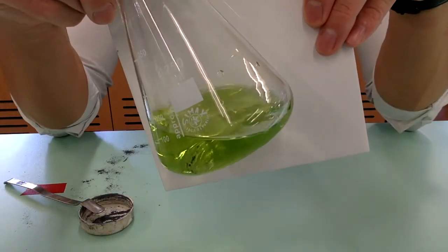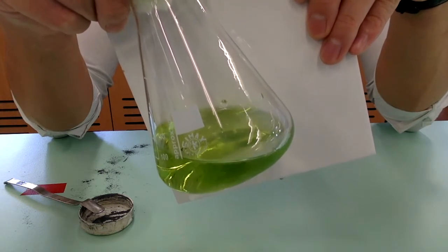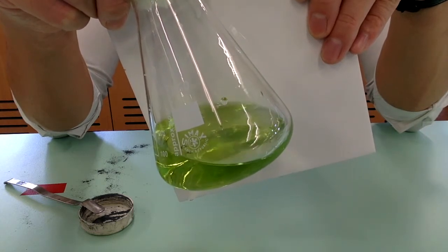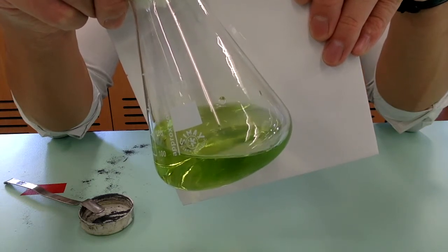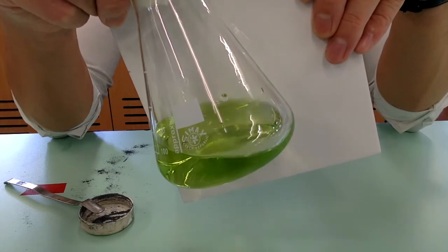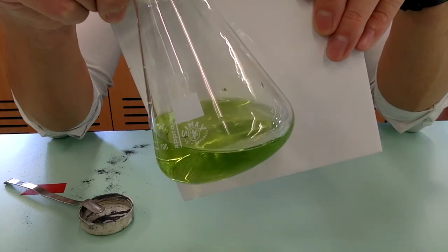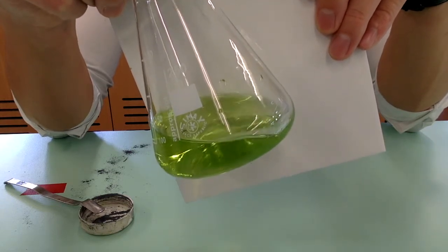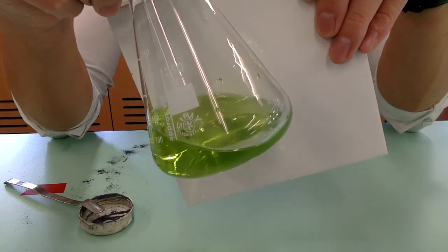At this stage, you may see a green solution — but do not mistake that for V3+. In fact, this green color is due to part of the yellow dioxo-vanadium(5) ions having been reduced to oxo-vanadium(4) ions. Since oxo-vanadium(4) is blue and dioxo-vanadium(5) is yellow, mixing yellow with blue gives a green appearance. So here it is simply a mixture of yellow dioxo-vanadium(5) and blue oxo-vanadium(4).